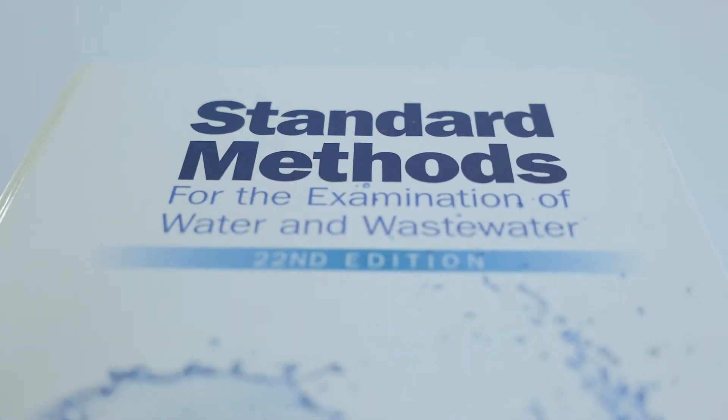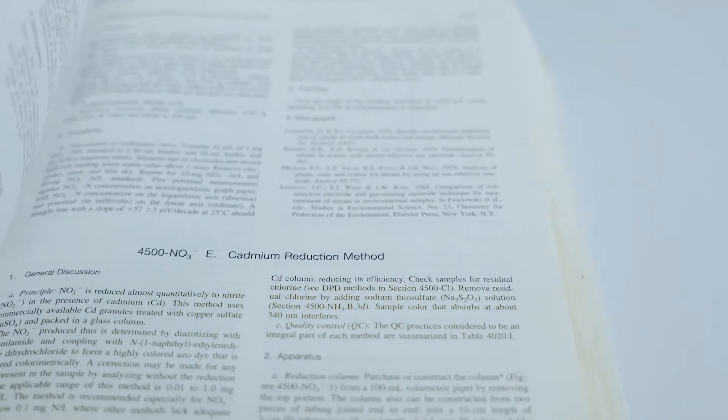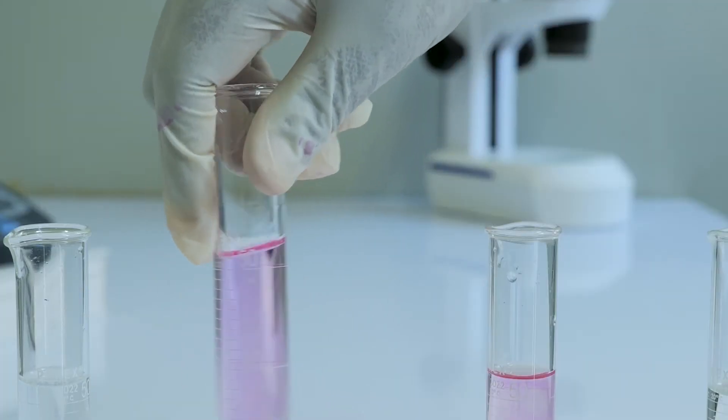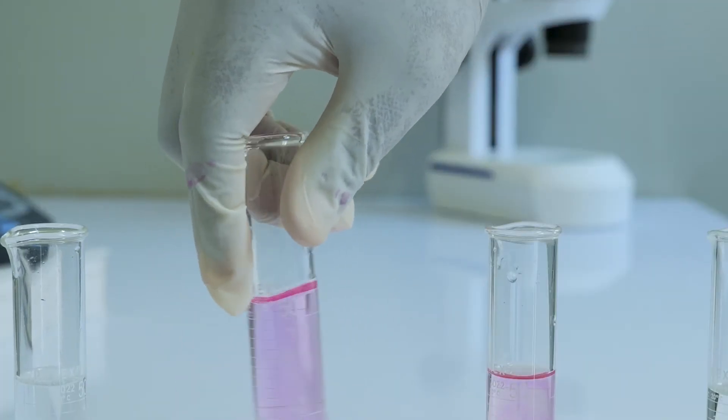The applicable range of this method is 0.01 to 1.0 milligrams nitrate nitrogen per liter.